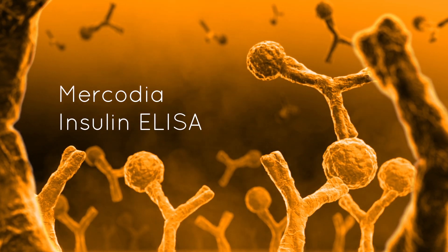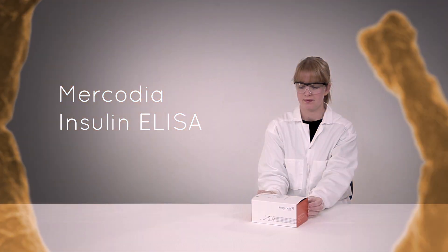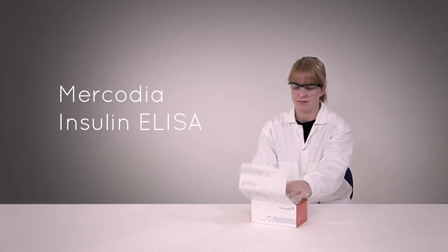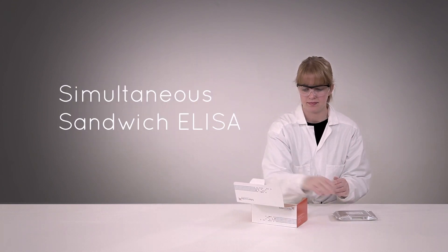This video will guide you through the procedure of running a Mercodia Insulin ELISA. The assay is designed as a simultaneous sandwich ELISA.